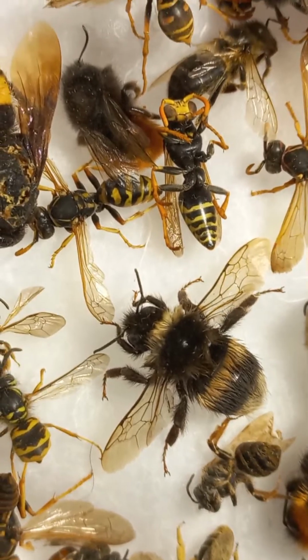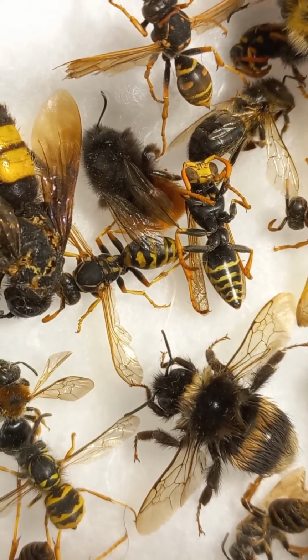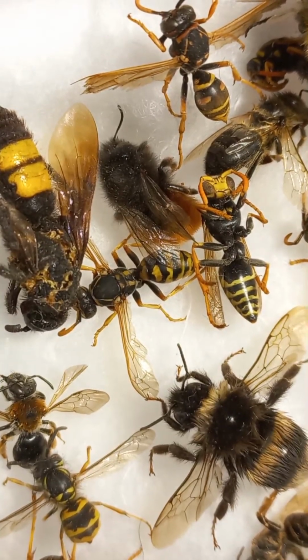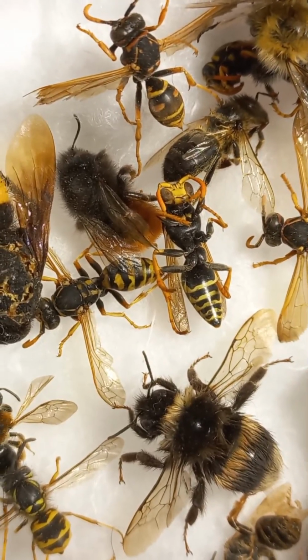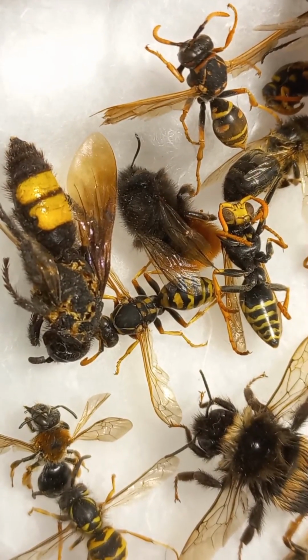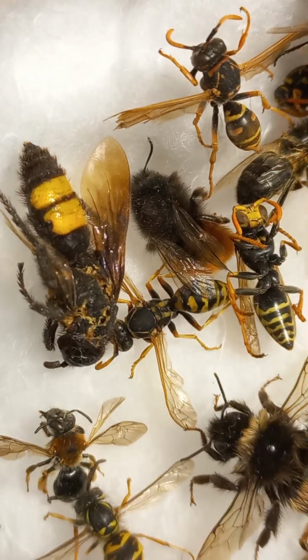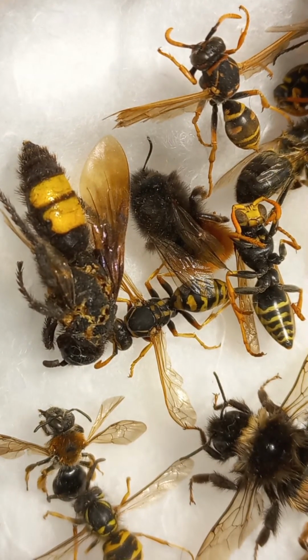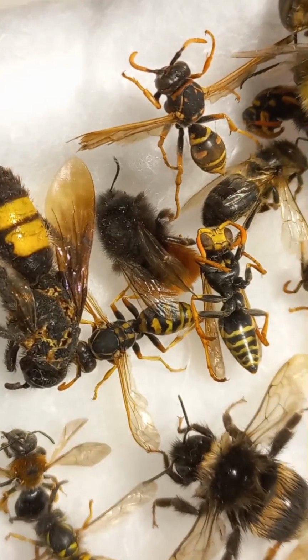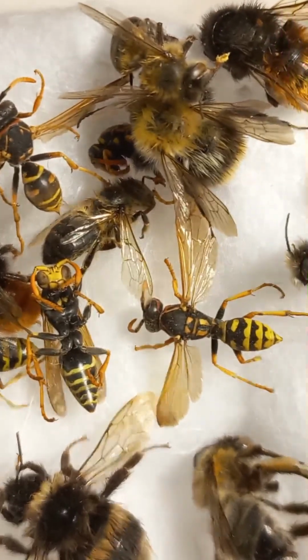A worker bumblebee, 2 big paper wasps of genus Polistes, and Osmia cornuta or Osmia rufa. I'm not quite sure. It needs to be watched under a microscope carefully. One smashed Scolia, family Scoliidae, a solitary wasp which is a parasite of Scarabaeidae beetle larvae. And you can see here 3 wasps of genus Polistes. Then there's another Polistes.